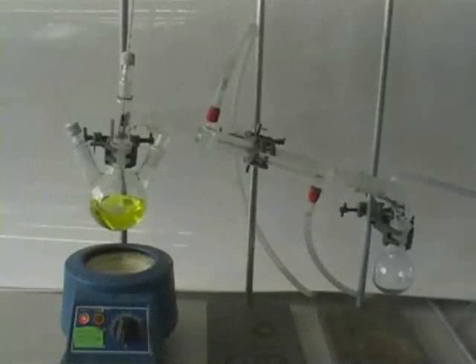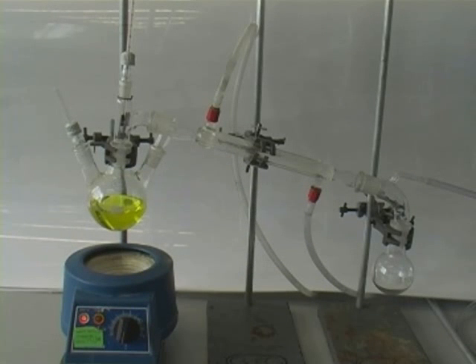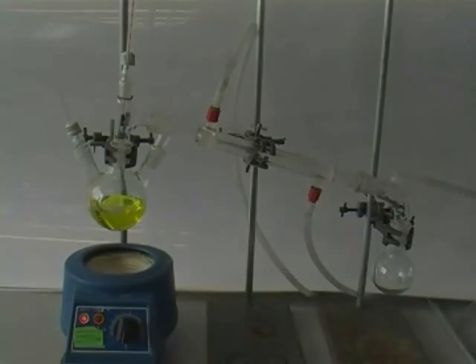Do make sure that you follow the instructions that you've been given, as different procedures and equipment may be used in different settings. In any case though, the overall process will be very similar to that of any distillation that you've performed. Thank you.